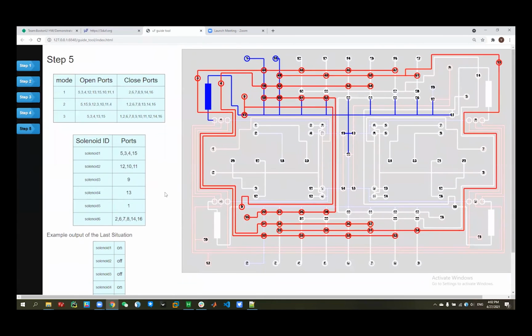So we go to the next step, and then we can see there is like a set for different ports. What it means. So we can see the 5, just for example, the 5 and 15. So here, both of them are opened in mode 2, and both of them are opened in the 3 modes. So they always have the same states in this sequence. So they will be satisfied. They will be assigned to the same solenoid set.